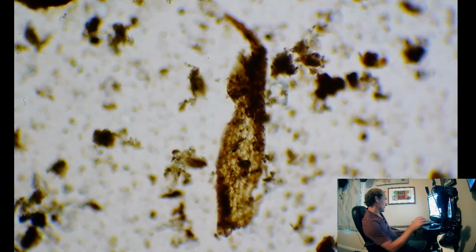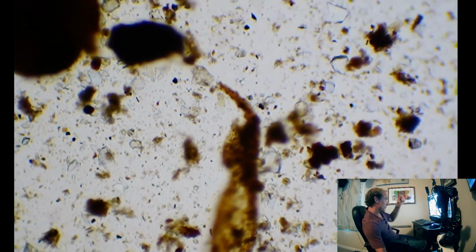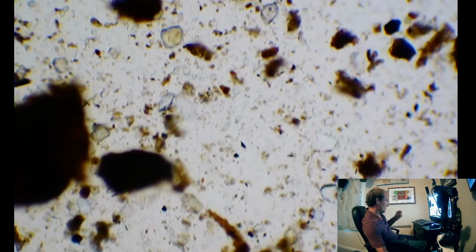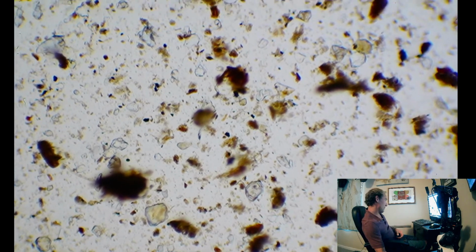Alright, so we see a good, nice, large piece of organic matter here. We can see that this was once plant matter. That's a good sign. But anyway, when I'm taking the sample and I get down below the compost, I tried to get a good happy medium of both the nice fluffy looking stuff, mostly my compost on the top, and what was down lower, which was really kind of like grayish clay, I would have to say.